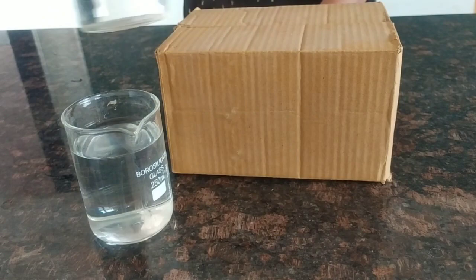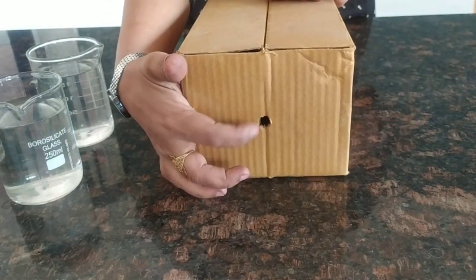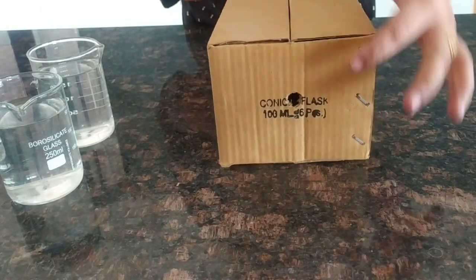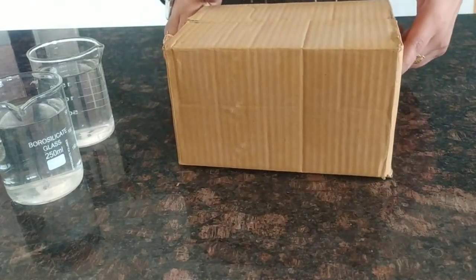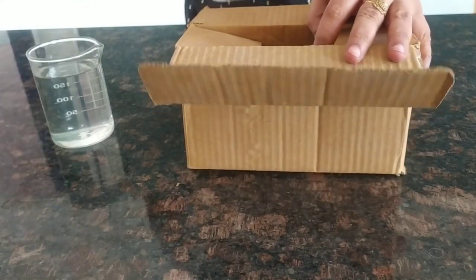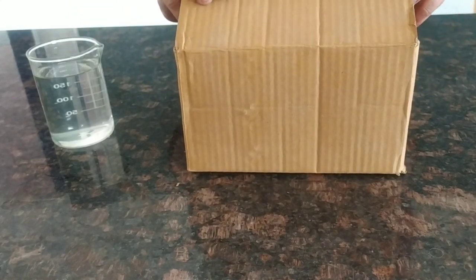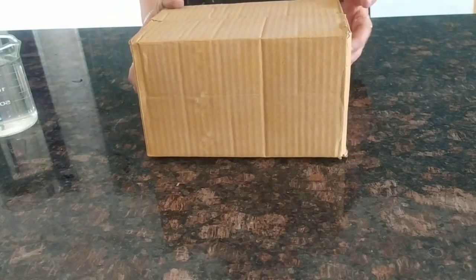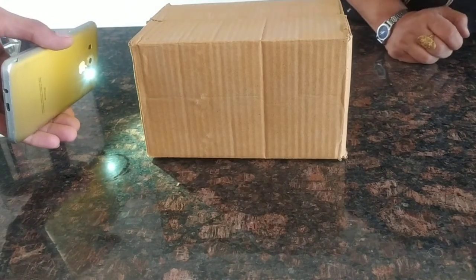We can take water from any other source also. In the cardboard box, I have made two holes on opposite sides, exactly opposite to each other, so that when light is thrown from one side it can be observed from the other side. First, we will place the first beaker containing the river water inside the cardboard box.